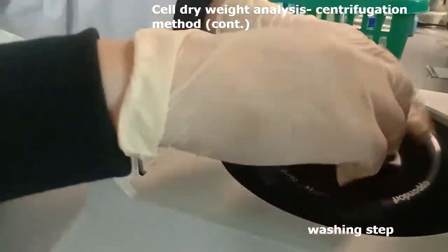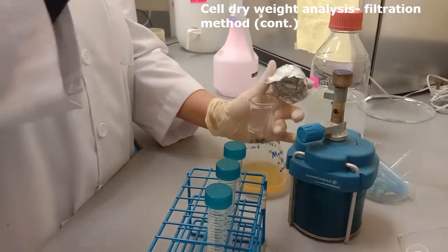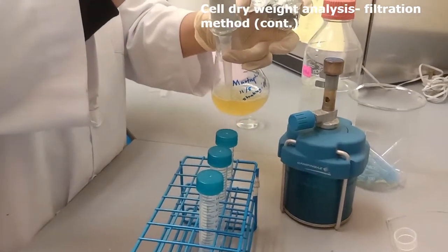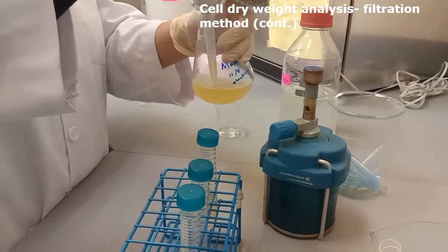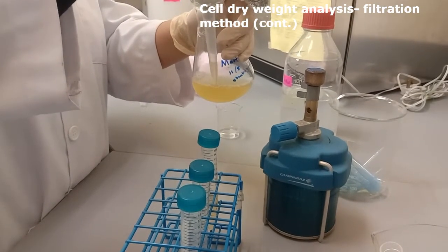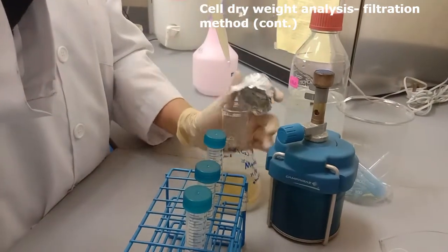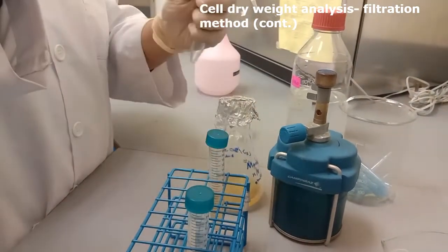Whereas for the filtration method, around 5 milliliters of sample is needed for each filtration. And remember to have triplicate for all your samples.